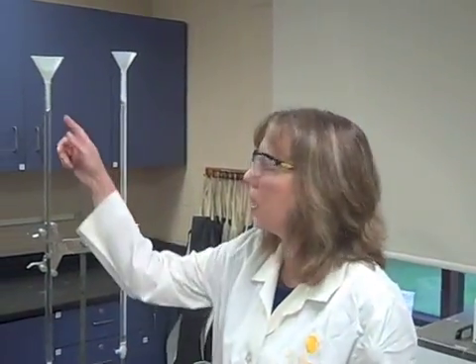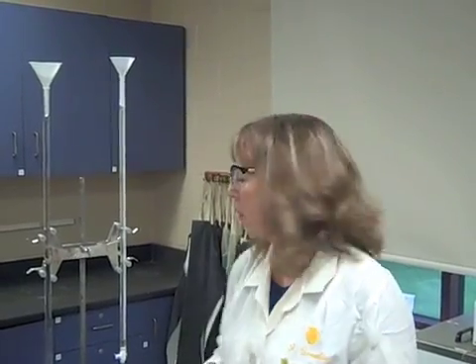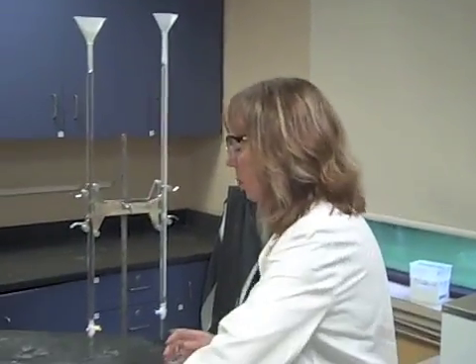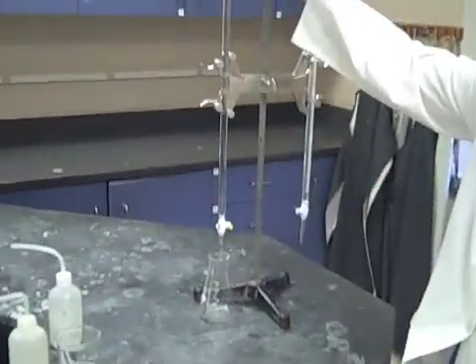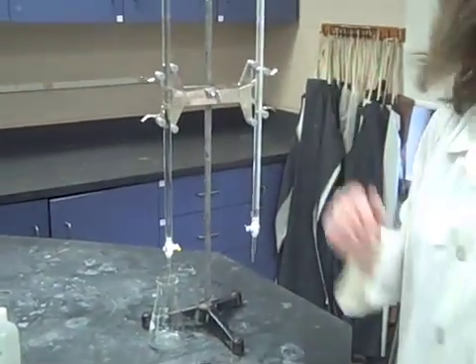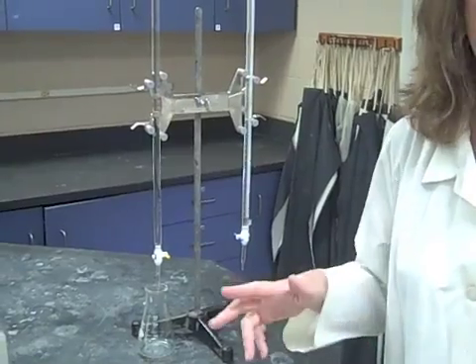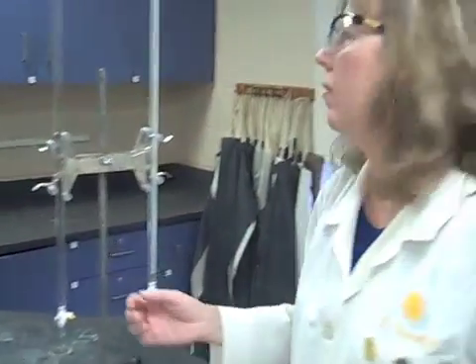We have already recorded the beginning volume of this acid. I'm going to show you now that I'm going to put this flask underneath and I'm going to let this fly down to whatever I want, somewhere between five and ten, then stop it and record the volume.